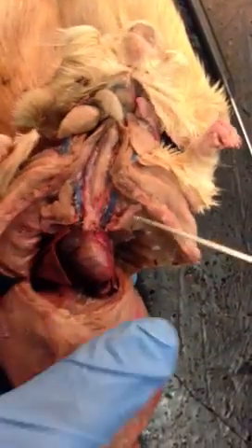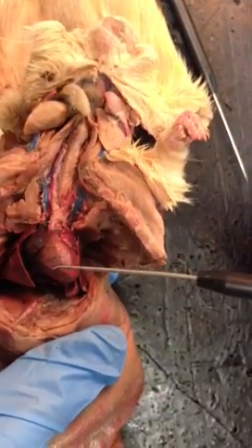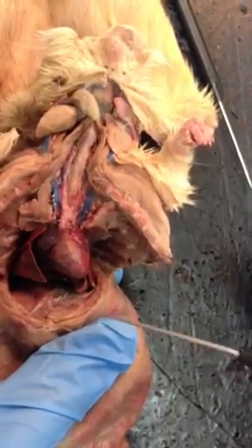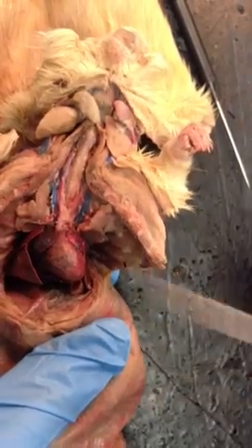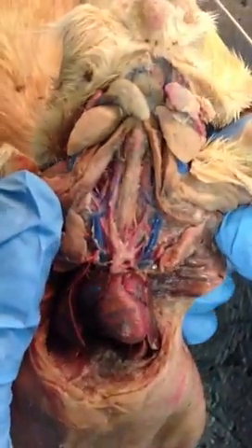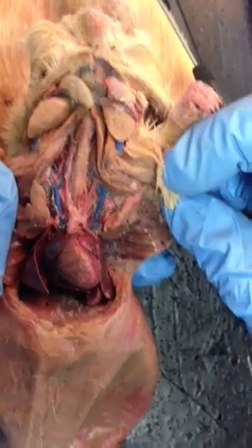Coronary artery and coronary veins. That's just the blue and red lines on the actual heart itself. The red is the arteries and the blue are the veins. And then where the two meet is the apex, and that's just a point on the heart. And then the pulmonary artery and pulmonary vein we couldn't really find because they go into the ventricles.